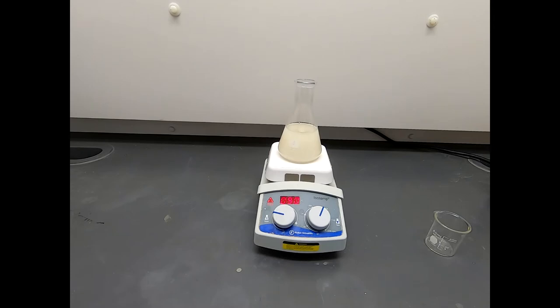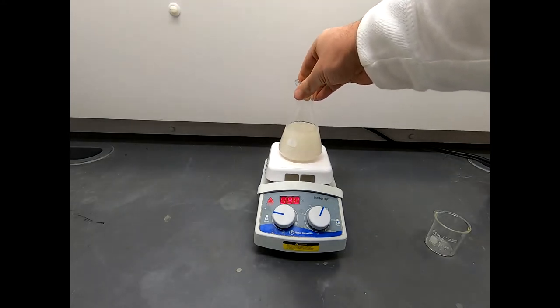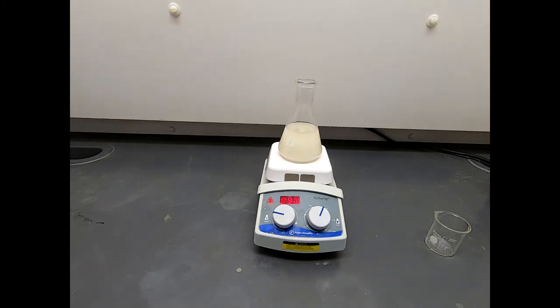The reaction has now been going for about two and a half hours, and there's a couple changes I point out. One, it's gotten more uniformly cloudy. I believe that is the formation of sodium chloride in the reaction. So that's sodium chloride in aqueous DMF is not terribly soluble, so you see that salt precipitate forming.